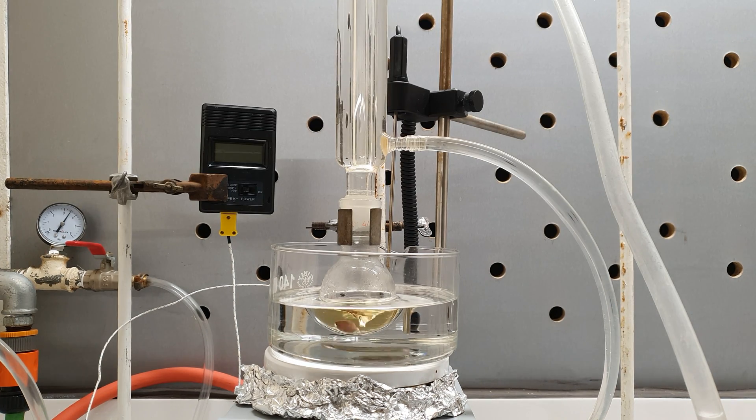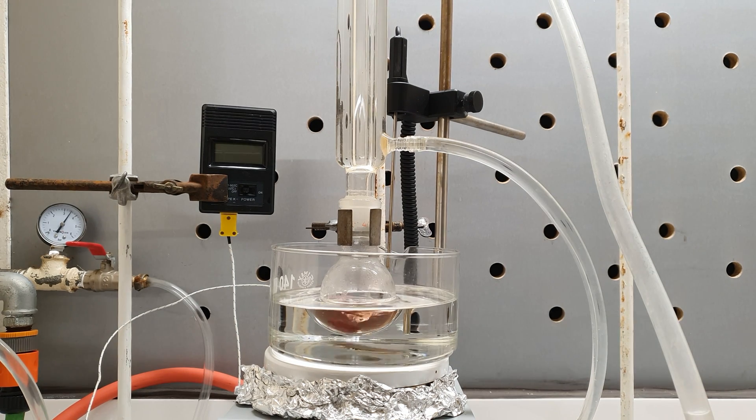Over the course of the reaction the mixture turned yellow and then kind of pinkish. I don't know why this happened but it was probably something to do with my acetic anhydride quality.